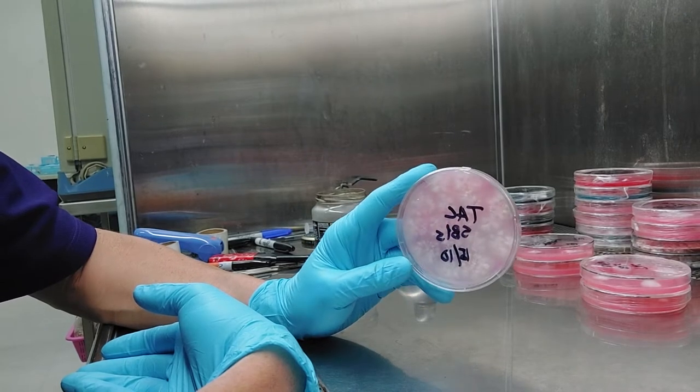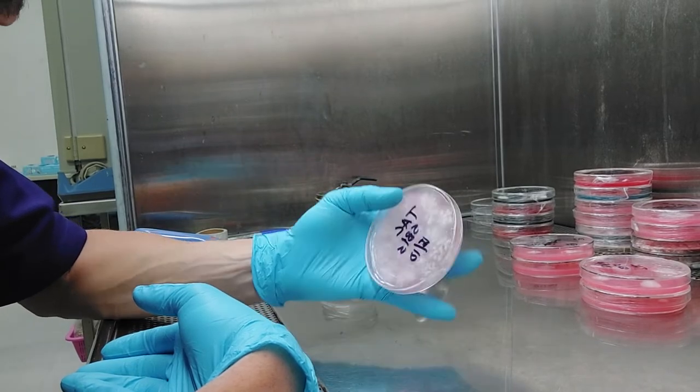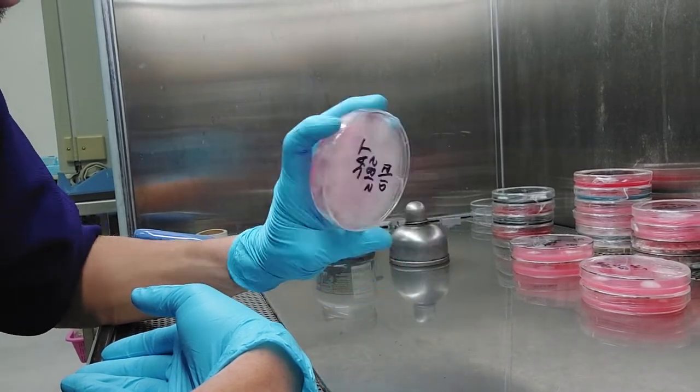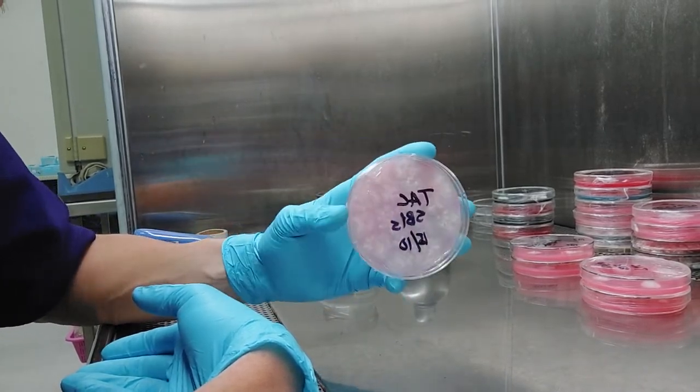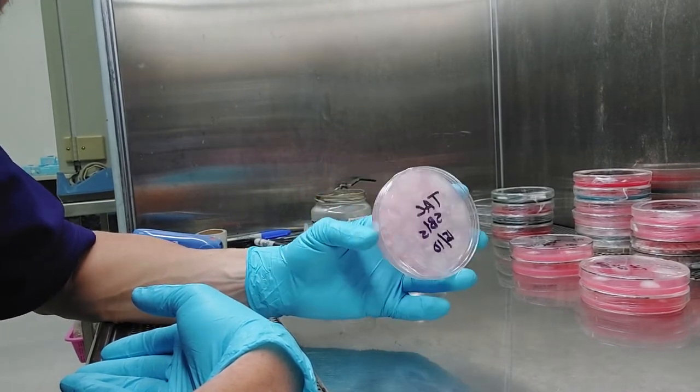There's several ways you can do it. You can do it with a syringe, you can do it with a spore drop, you can do it with a ghetto method. You can just look up serial dilution or some form of that on the internet or YouTube.